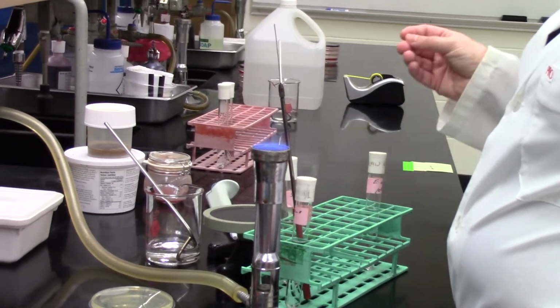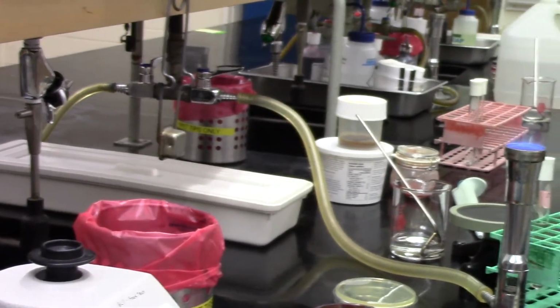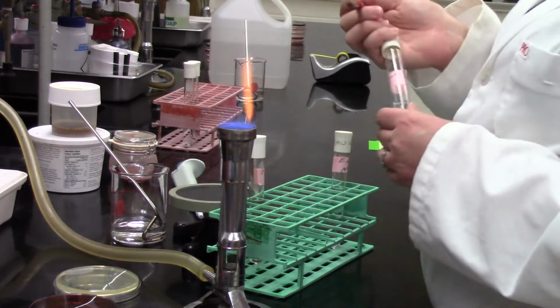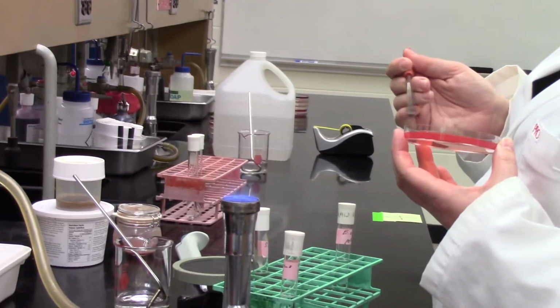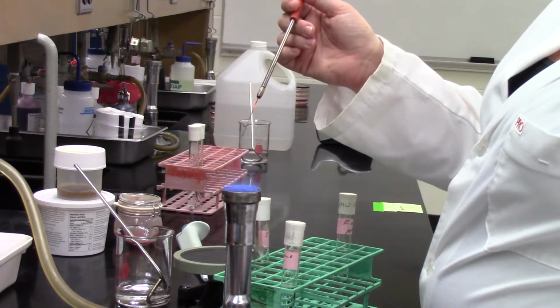Obviously, when you're working with multiple known bacteria, or multiple different samples for that matter, your aseptic technique becomes very important in order to prevent cross-contamination. So you want to make sure your loop is fully sterilized before you dip into a different culture of bacteria. Now she's working with that lovely cherry red mannitol salt agar plate and inoculating with Staph aureus.